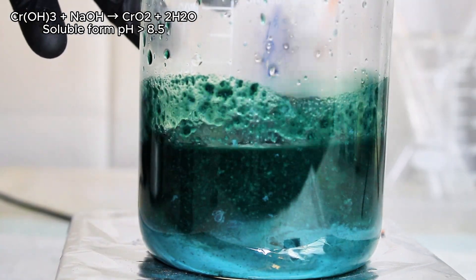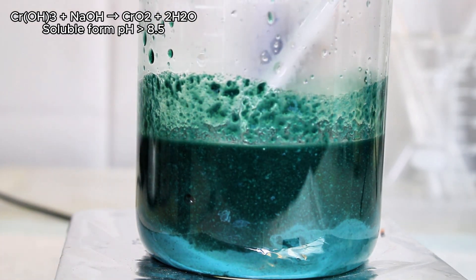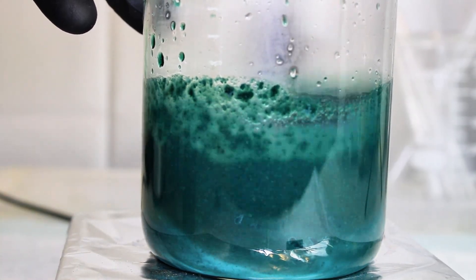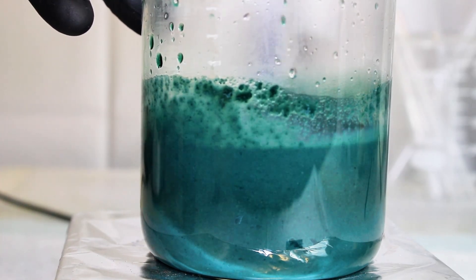And come to think of it, this means it might make a good candidate for an alkaline electrolysis to isolate pure chromium. I'll be sure to give that a try at some point and let you guys know how it works.